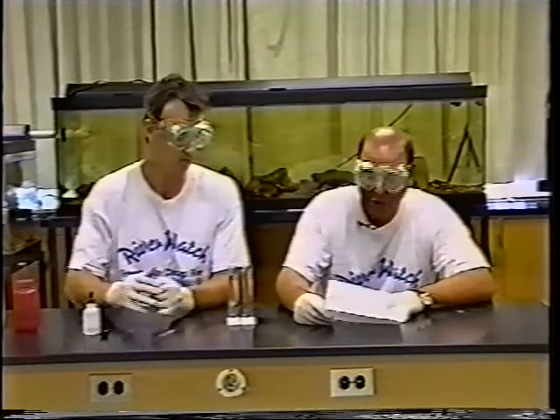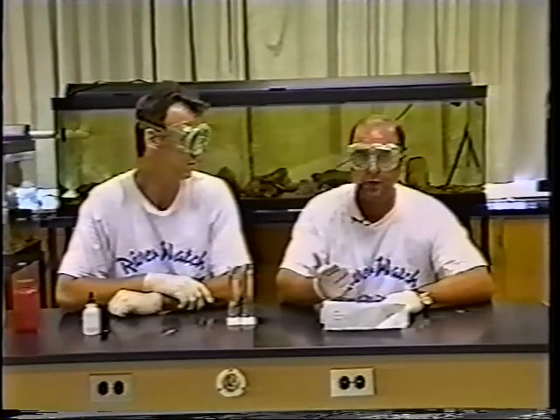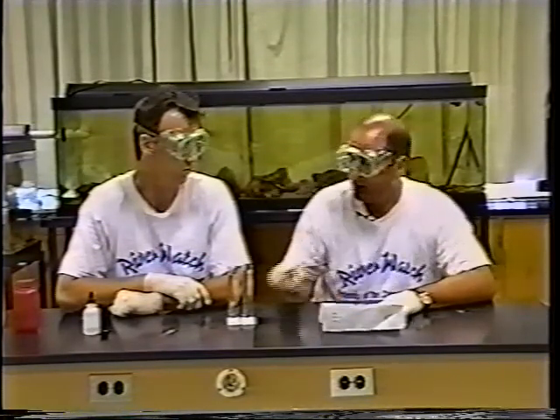It took eight drops to match up with the 50 milliliters, and each drop is equal to five Jackson turbidity units (JTU). A Jackson turbidity unit is simply the unit we use to measure turbidity, just like pounds or grams measure mass. So eight drops times five equals 40 Jackson turbidity units. If we had used the 25 milliliter amount because the river was very turbid, each drop would equal 10 JTU instead of five.